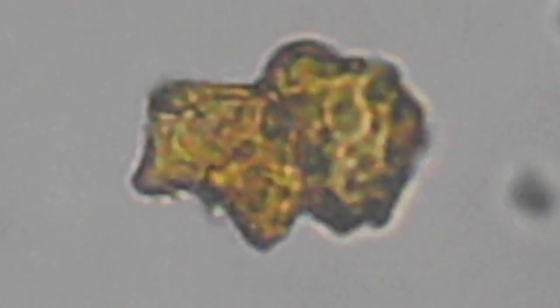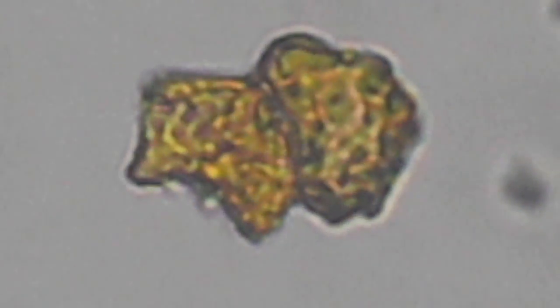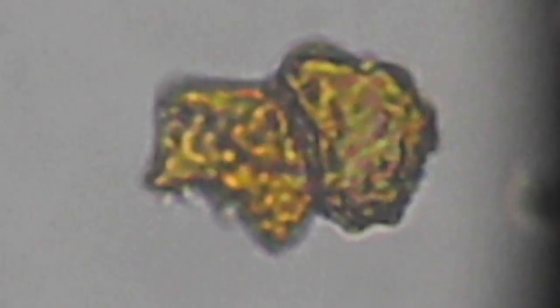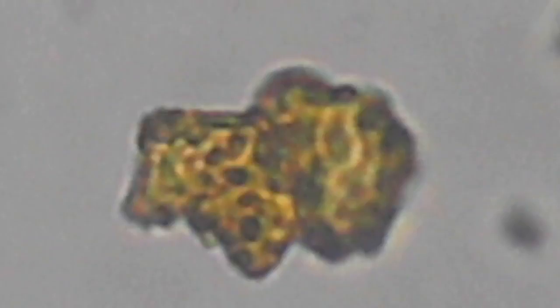Bacterioform gold — the optical properties clearly show the cellular structure of this bacterioform gold.